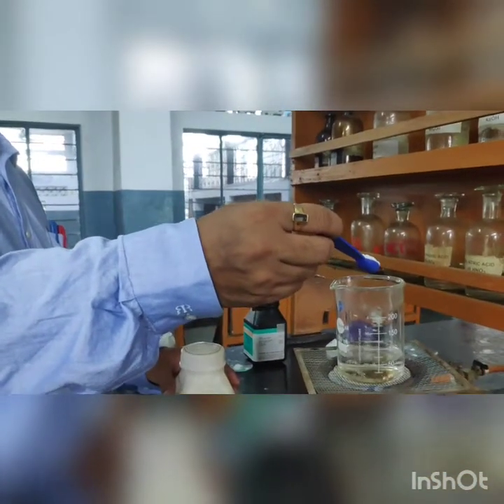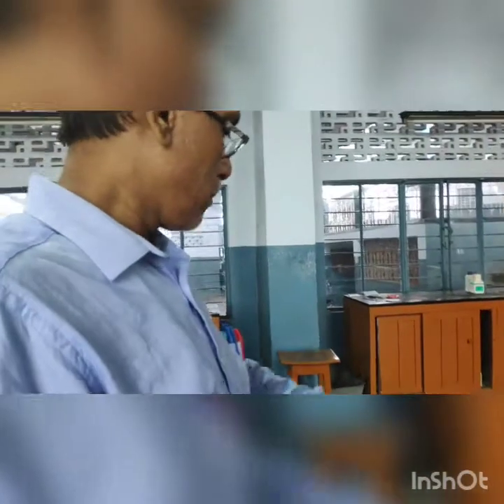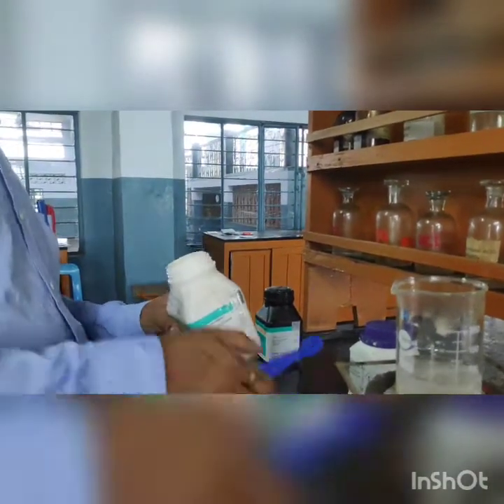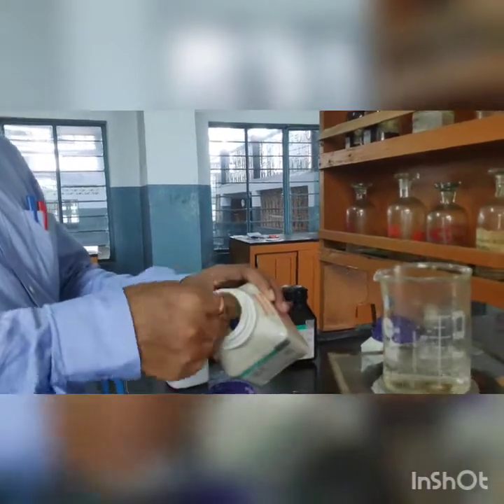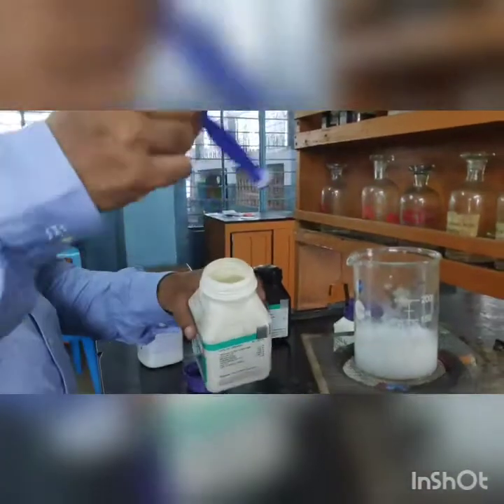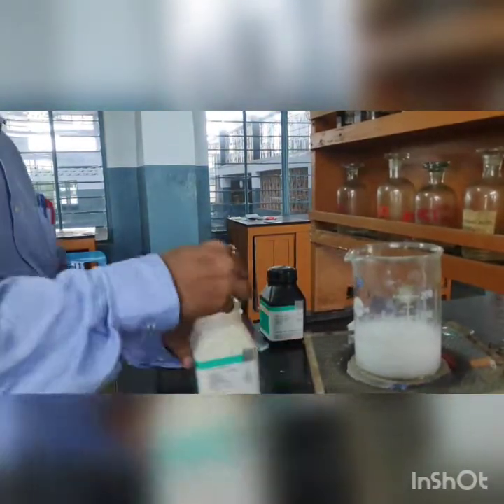Sir has placed a beaker containing water to which he is adding one spoon of magnesium sulfate salt. To this we are going to add in the ratio of 1:3, three spoons of sodium carbonate. When this sodium carbonate is mixed with the salt and boiled for some time, the sodium carbonate extract will be prepared.